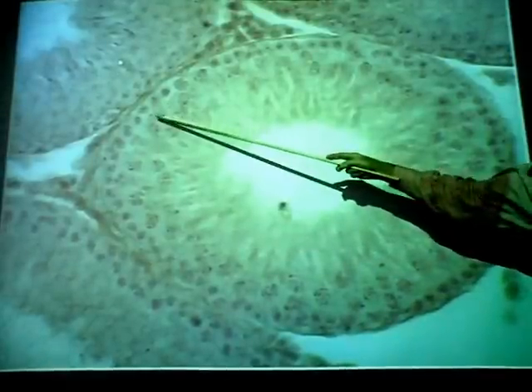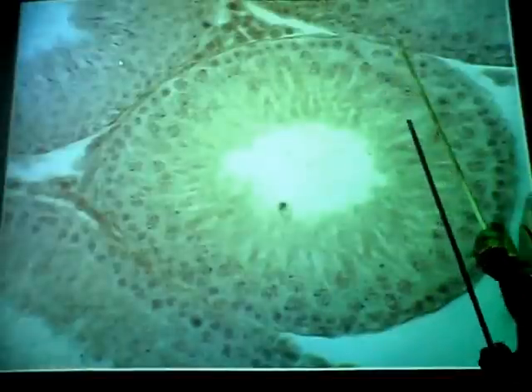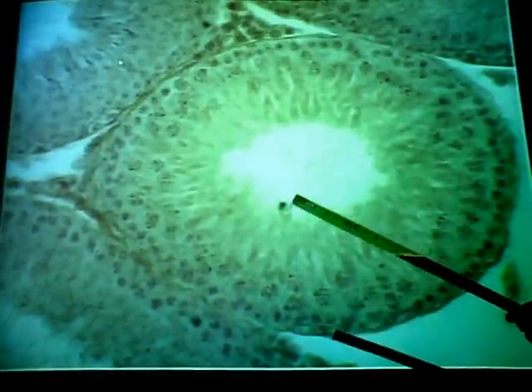Most of the cells that we see here, at least the nuclei of those cells, are called spermatogenic cells. And on the slides, you can refer to them just as that. On the bubble charts that I went over yesterday, you must know the names of the specific cells, as well as whether they're haploid or diploid and how many chromosomes they would carry. Okay? There are, however, some other cells in the wall of the seminiferous tubule.